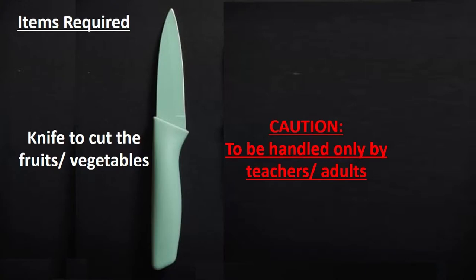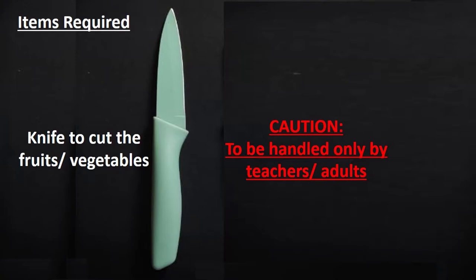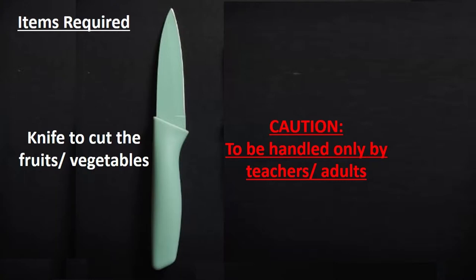Additionally, we will also require a knife to cut the fruits and vegetables. Please use the help of your teachers to handle the knife and do not do it yourself.